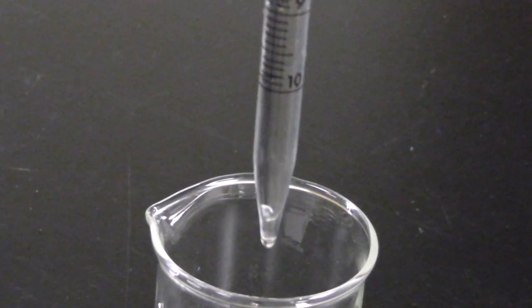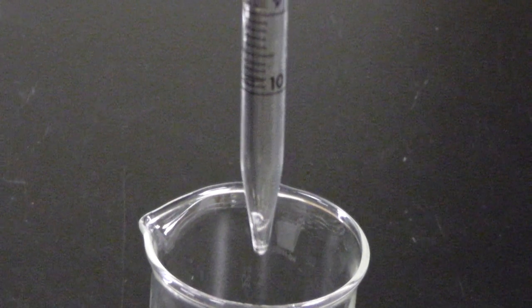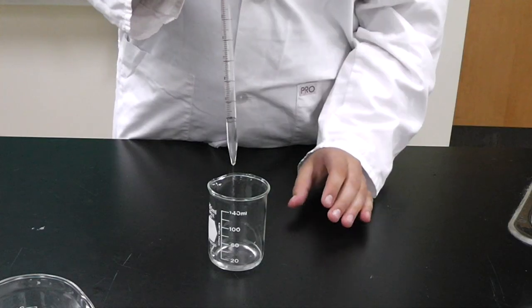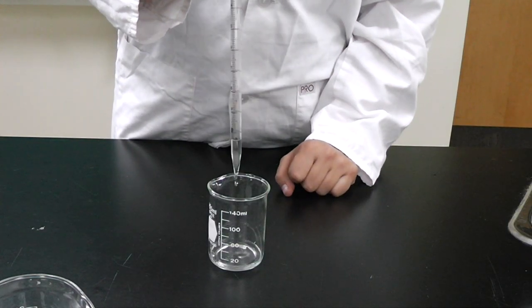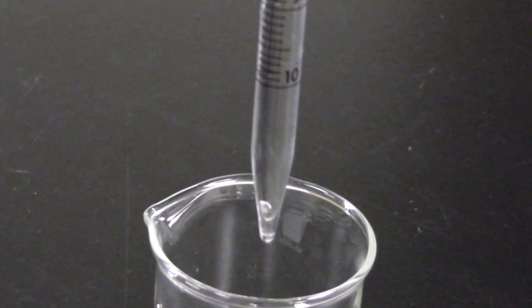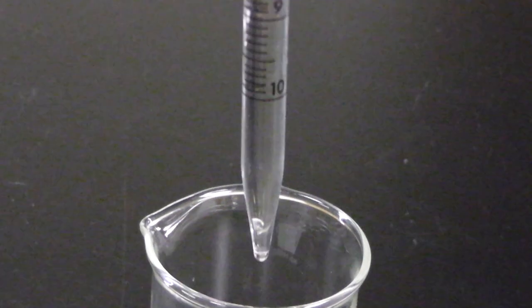Please be very aware that the bottom of the pipettes do not have increments or markings. So, for example, filling it to the five milliliter mark and letting it drain completely, as such, would not be an accurate measurement of five milliliters. You must only dispense the controlled amount of liquid between these first and last markings.